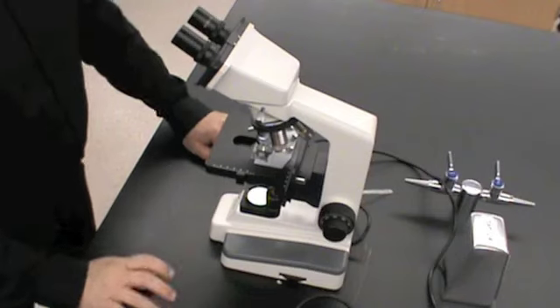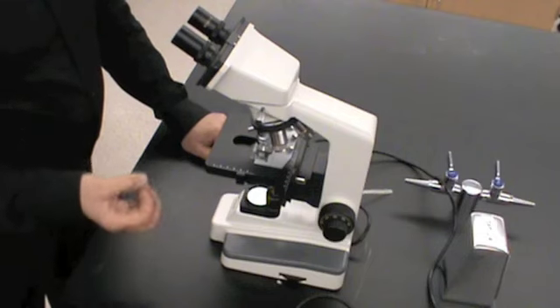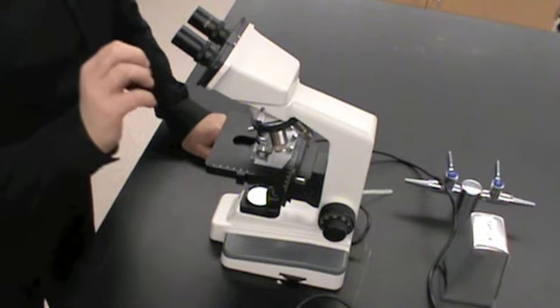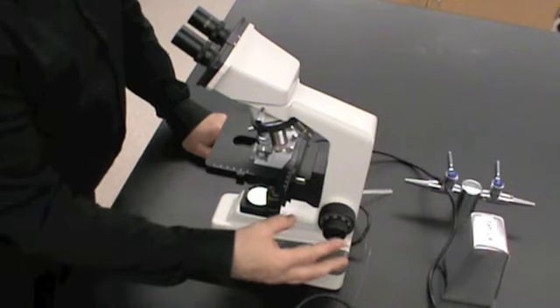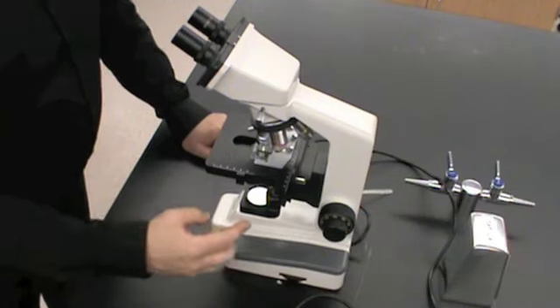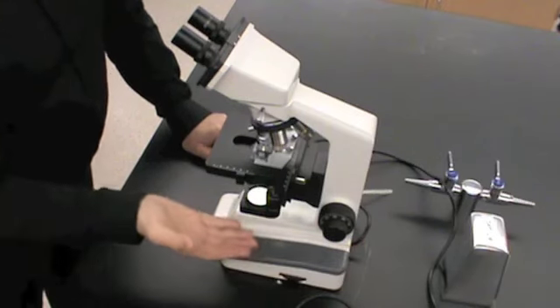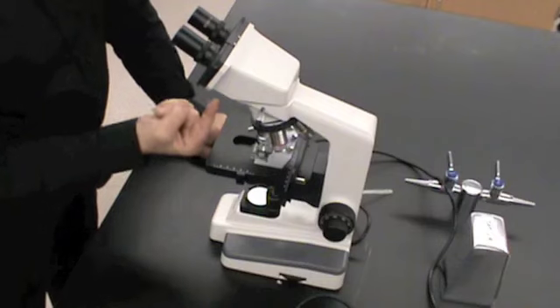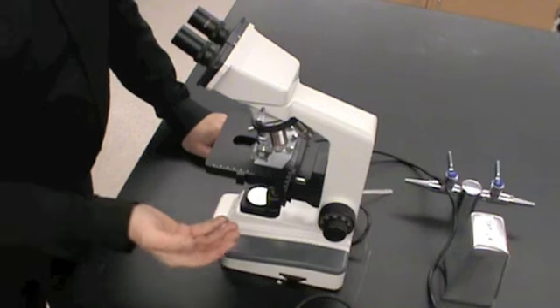And the oil helps the refractive index, and it will give us sharper and clearer images and measurements. But now we will have to focus on oil immersion, and once again, we only use the fine adjustment. We never use the coarse adjustment unless we're on the lowest power. And the reason for that is that when we use the coarse adjustment, there's gross movement of the stage. And at some point, you could move the slide into the objective lens and crack the slide or damage the lens.